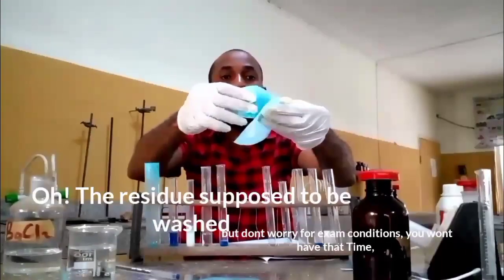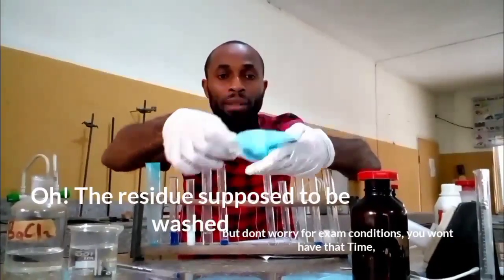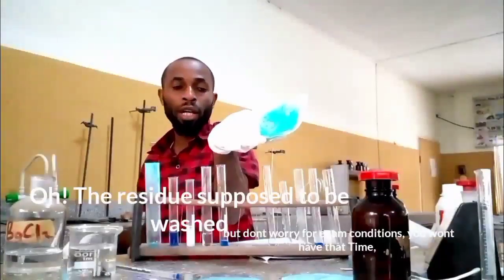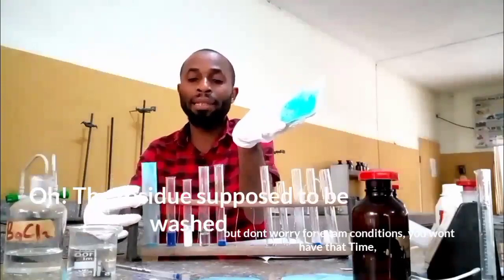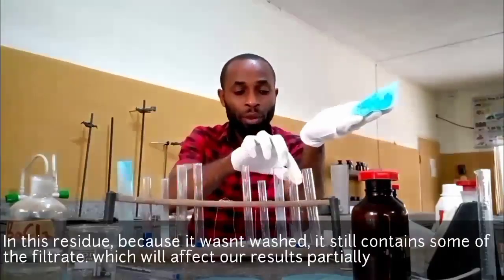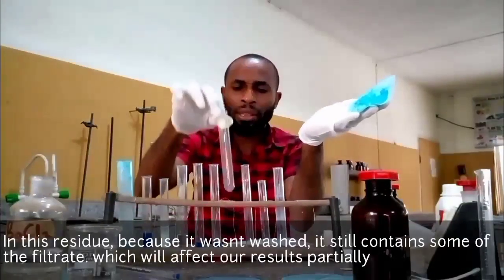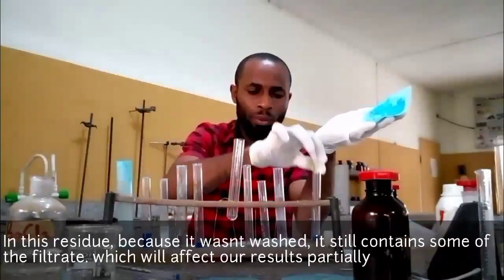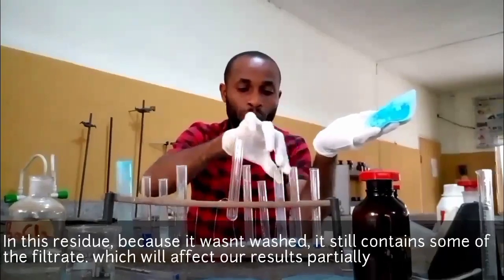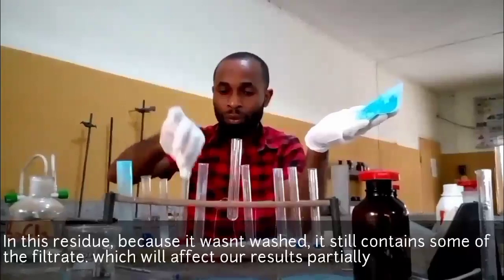Okay, I can open the residue here for you. You can see the residue here. This is the residue. Okay, we are to work with the residue. Remember that these are the results we had from the filtrate. I'm going to use this place for the results we are going to have in our residue. And you know, our residue is supposed to be insoluble in water. Let me pick this to the other side so that I will not confuse us over this matter.